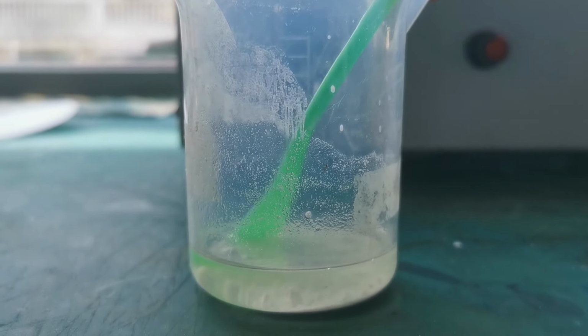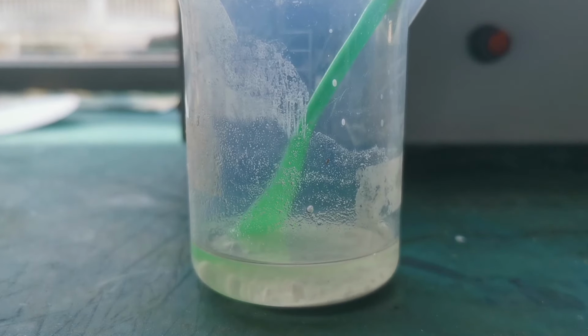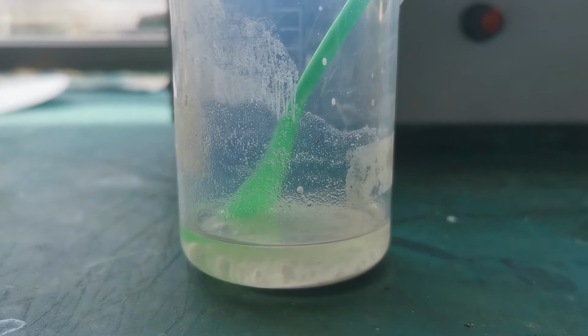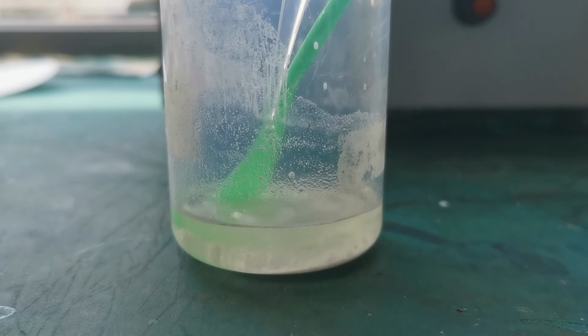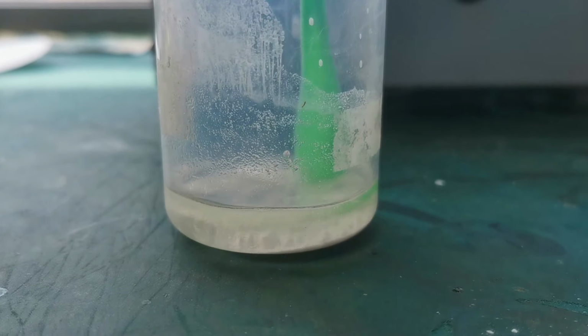TCCA has a large solubility in chlorinated solvents, so this could only be impurities. I deduced them to be inorganic bases like sodium carbonate, since my TCCA pool pills were advertised as quick release, and it releases a lot of gases when I try to dissolve it in water. The TCCA likely reacted with the sodium carbonate to form CO2, cyanuric acid, and sodium hypochlorite, which made the pills dissolve much quicker than pure TCCA.